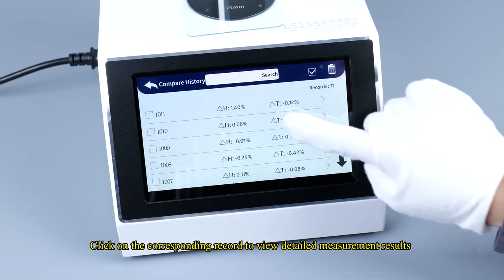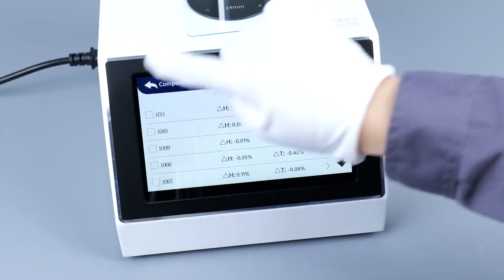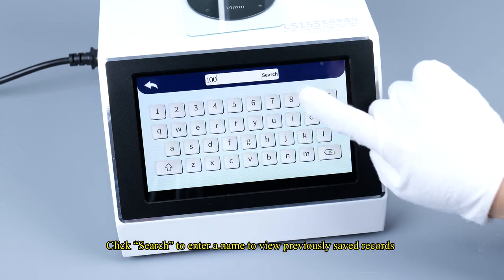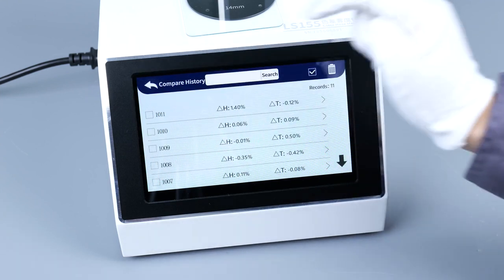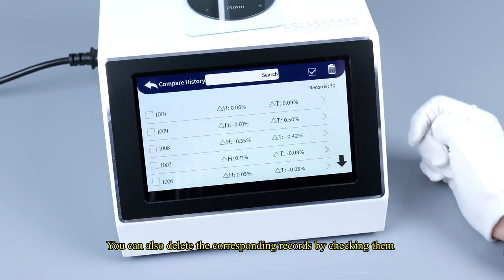Click on the corresponding record to view detailed measurement results. Click Search to enter a name to view previously saved records. You can also delete the corresponding records by checking them.